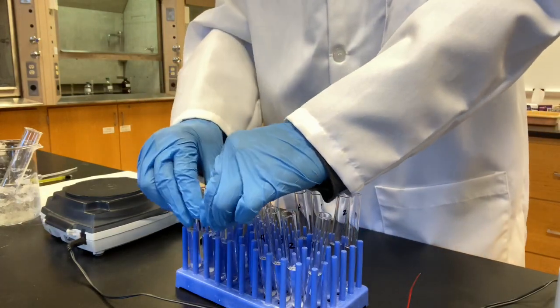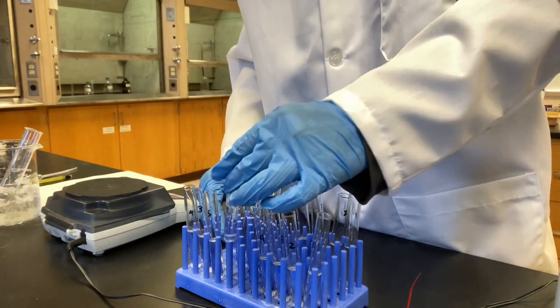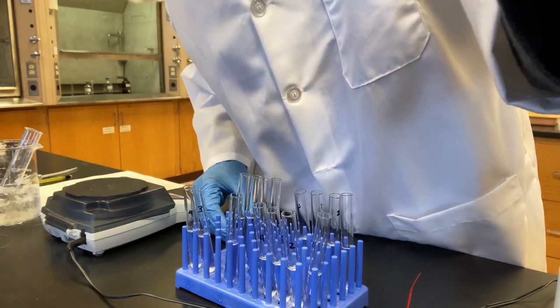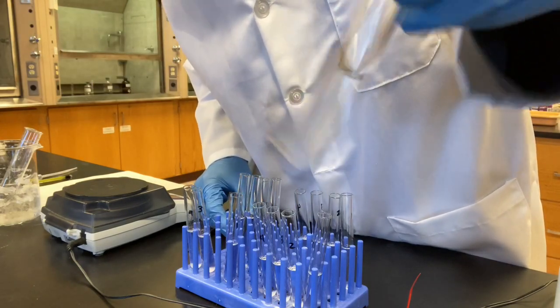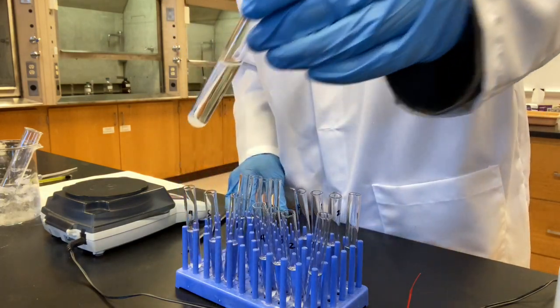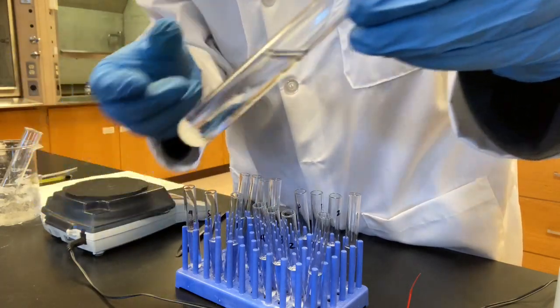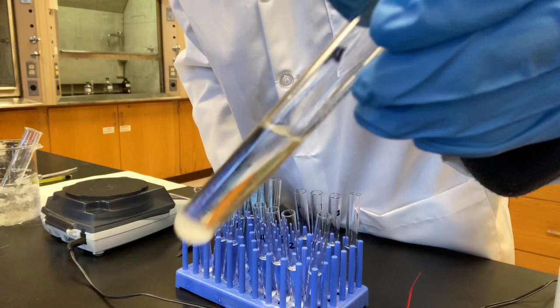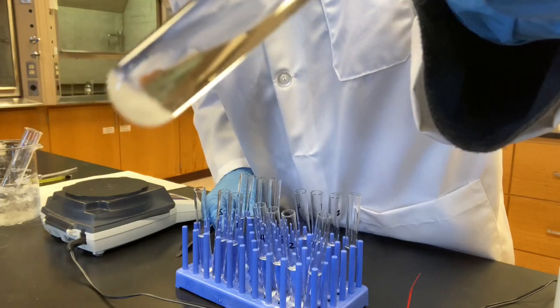Now the last group, which I already did. Potassium acetate in water, all dissolved, soluble. In ethanol, there are a few particles at the bottom. If you don't look at it carefully, you may miss it. Very, very small particles at the bottom, soluble. Look at that. Potassium acetate in acetone, insoluble. And potassium acetate in petroleum ether, insoluble.